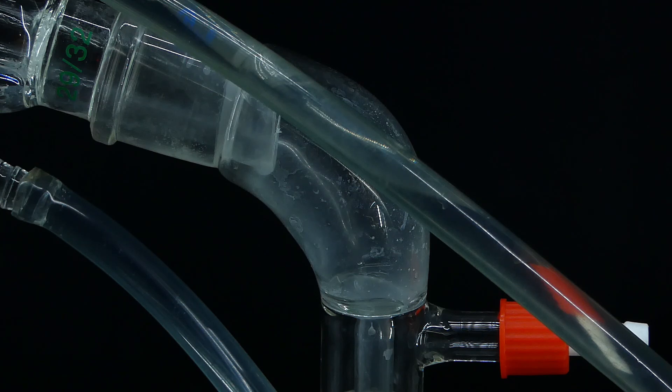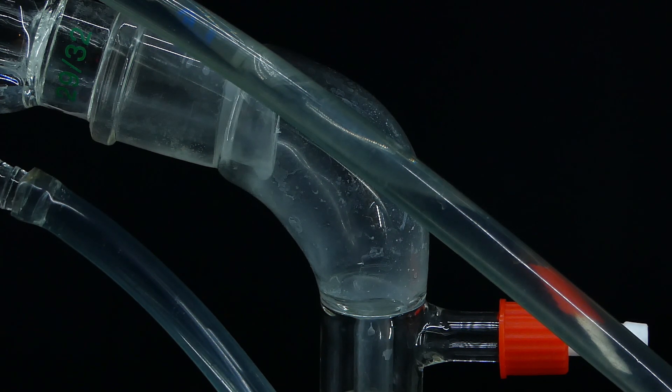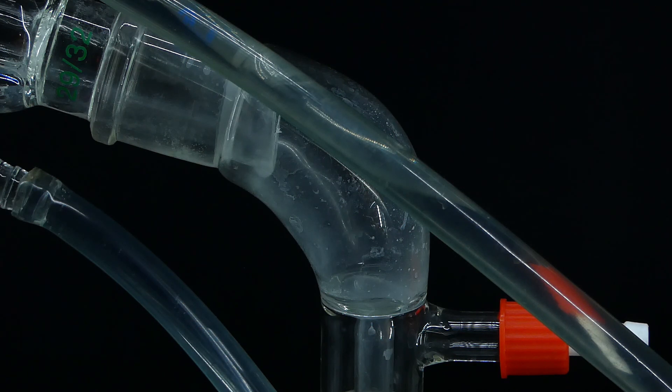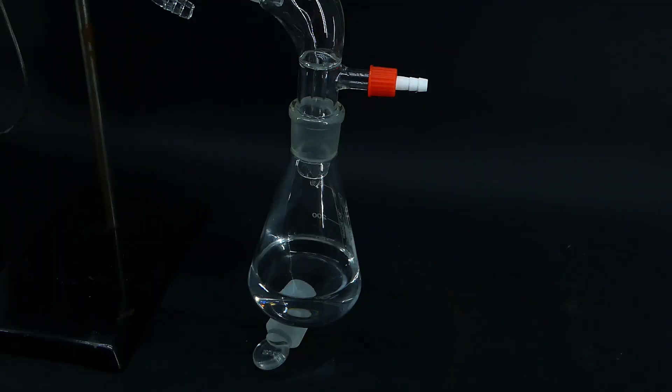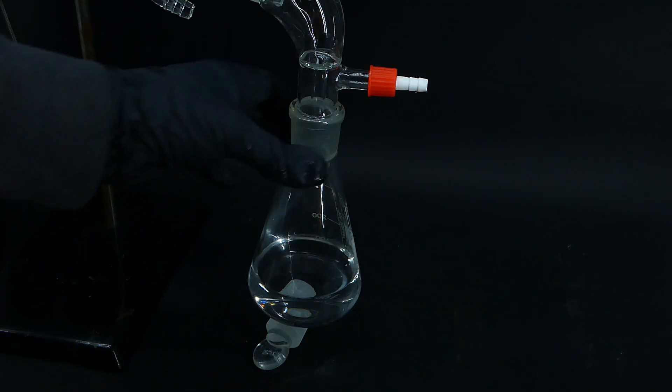After some time, the distillation apparatus got covered with a white layer, which was a product of the reaction of trimethyl borate with residual water on the walls of the apparatus. I actually wanted to dry it before the distillation, but of course, I forgot to do that. After the distillation had finished, I turned off the heat and collected the distillate.